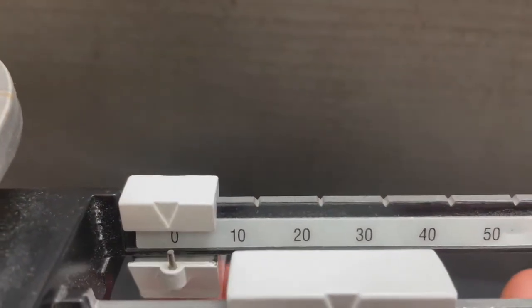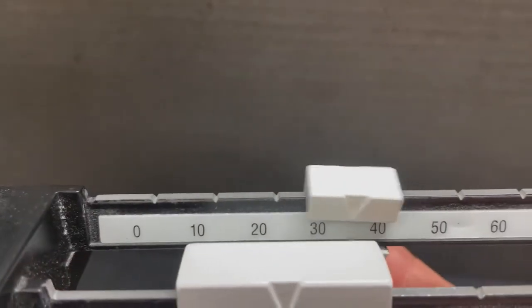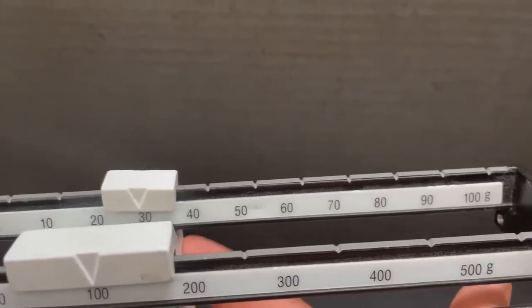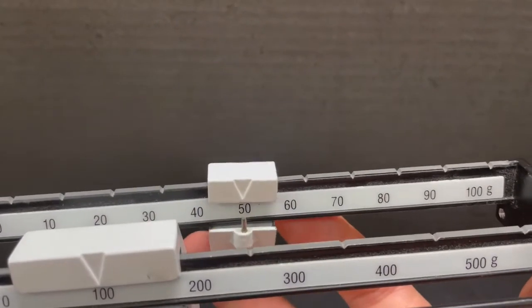If we use the 10 gram weight, we just kind of push it over until we get a movement out of it. Let's take it up to 50.